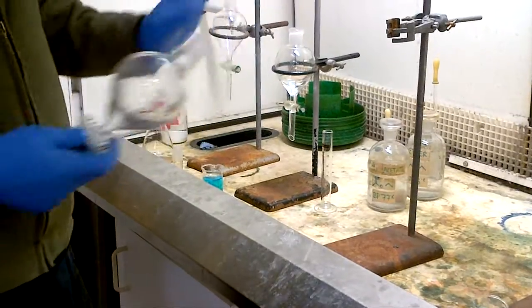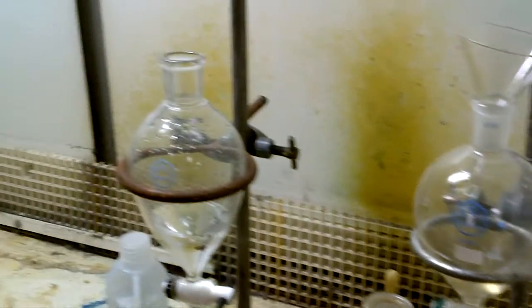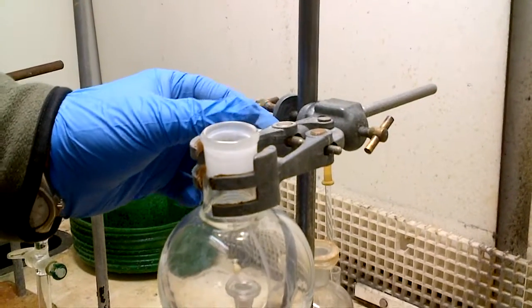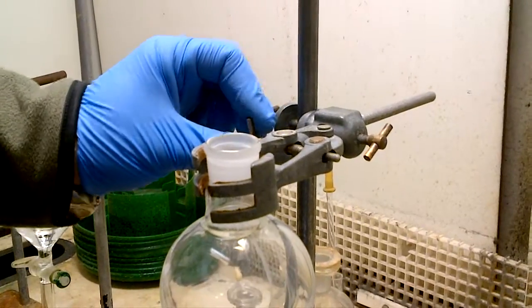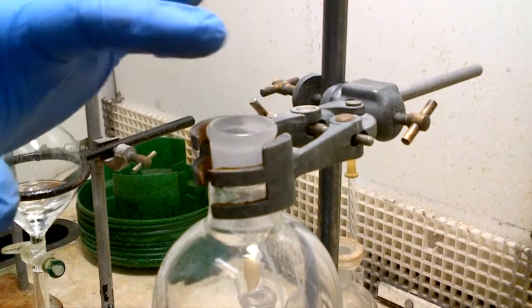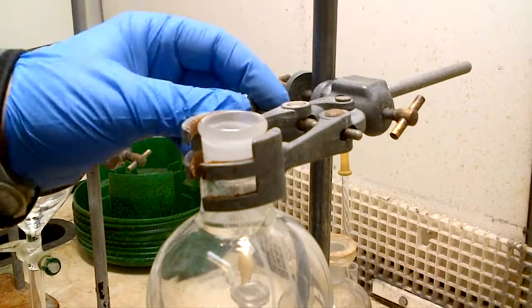And how do you clamp it? Well, you can see that these are clamped on these kind of O-rings here, but here's just the bottom clamp. If you were to clamp in this mechanism, it's best to clamp via the neck of the flask and do it firm and secure, but don't tighten too much in case you shatter the neck of the flask.